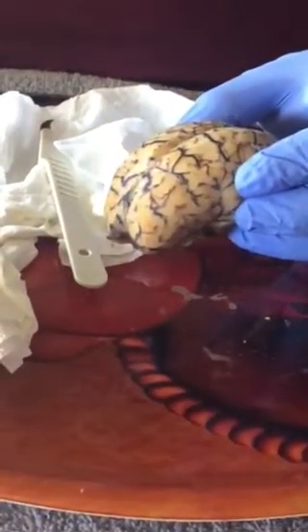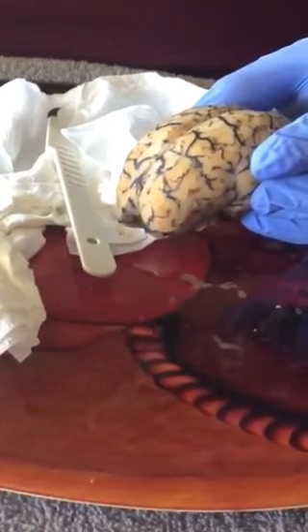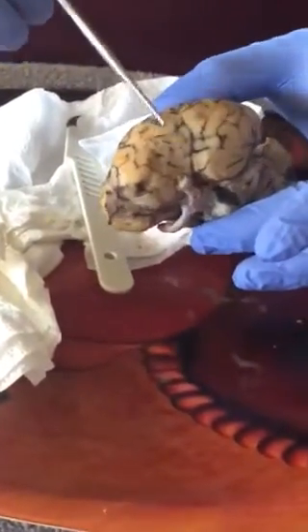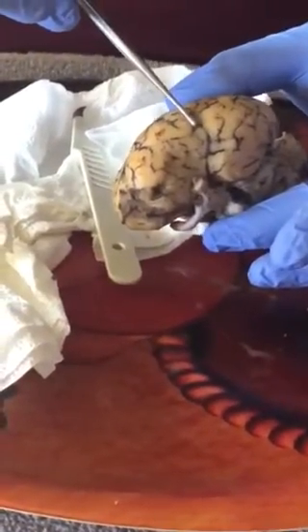I'm going to be showing what the lateral sulcus is and how it separates the temporal lobe from the parietal lobe. So the lateral sulcus is here on this side. That's why it's called lateral sulcus, and it's this line here. That one is the earliest developing sulcus. It divides the frontal and the parietal lobe from the temporal lobe below.